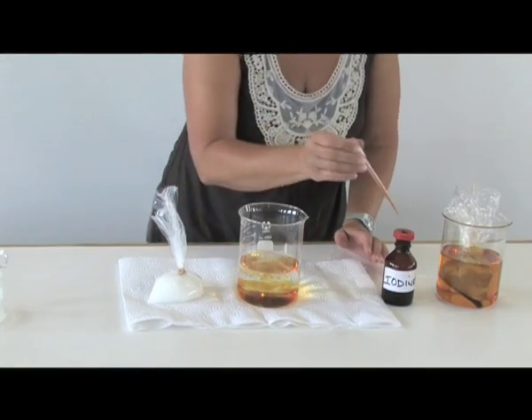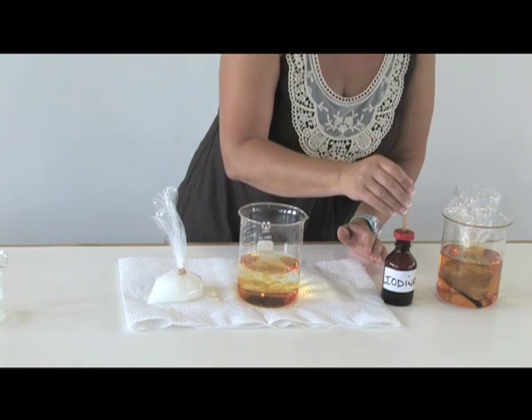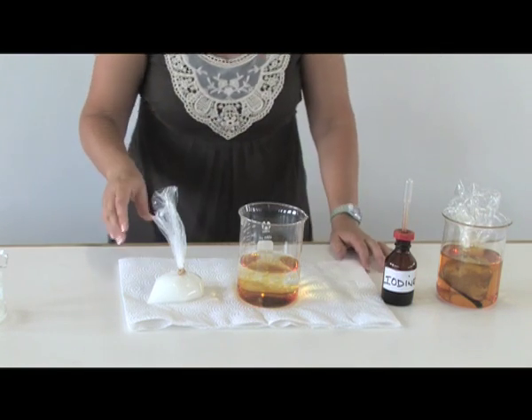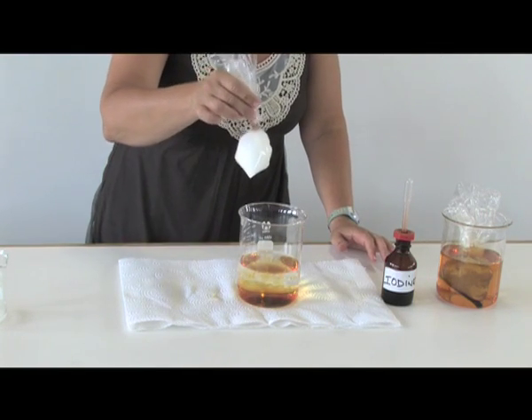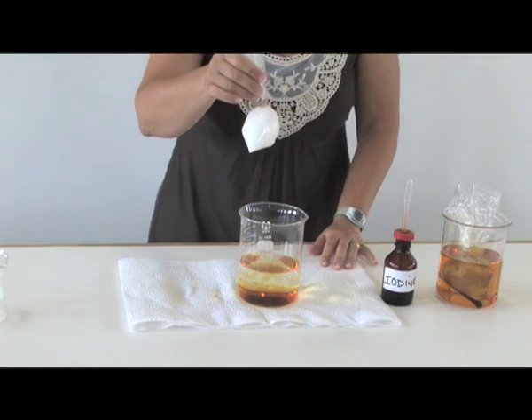We all know that we use iodine as an indicator to prove the presence of starch.